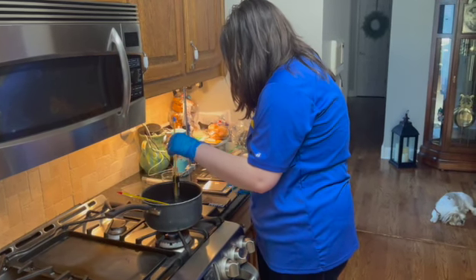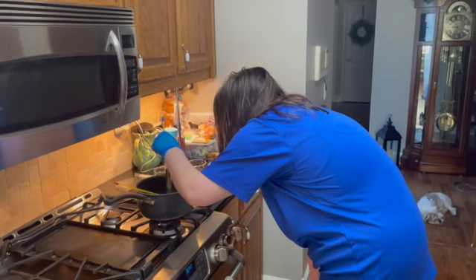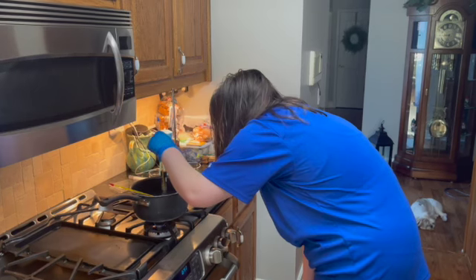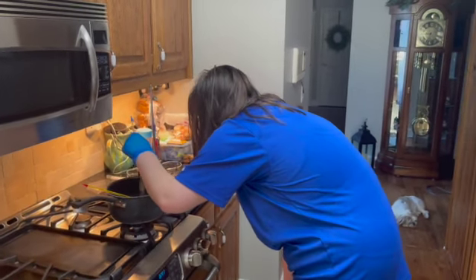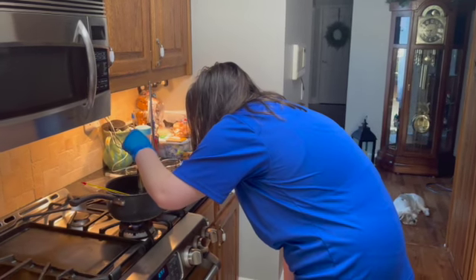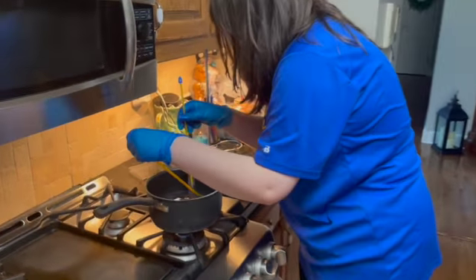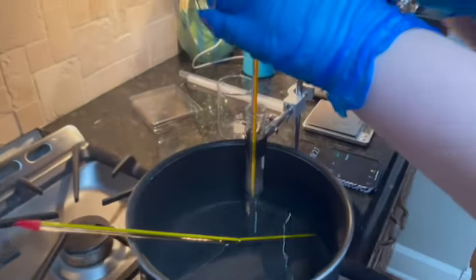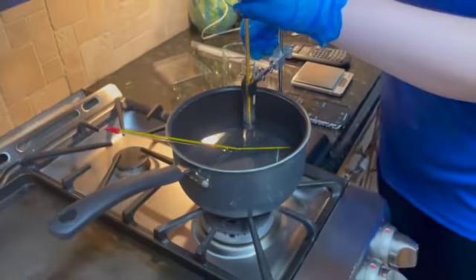This is close to the 20-minute mark, and it is. I'm going to stop the time there because it is completely melted through, and the ending time is 20 minutes and 19 seconds. And at this time, the solvent is at 55 degrees Celsius, while our hot bath is at 55 degrees Celsius. And so we've completely melted that down, so we're done with part A.